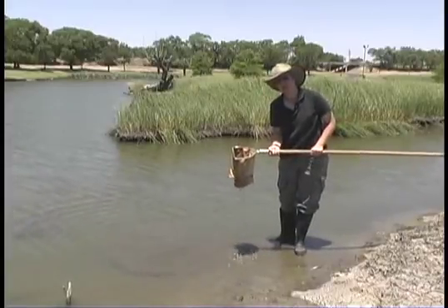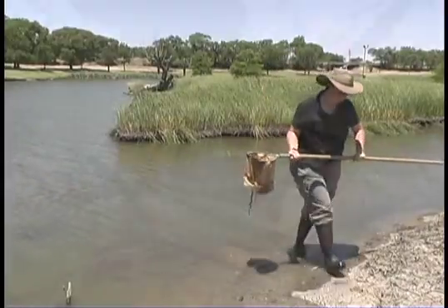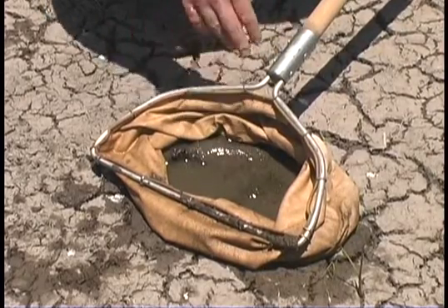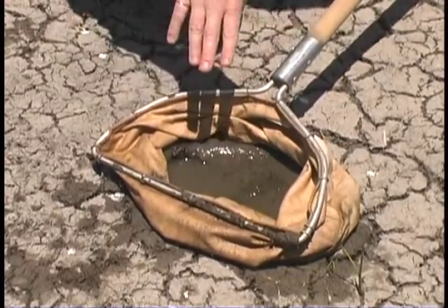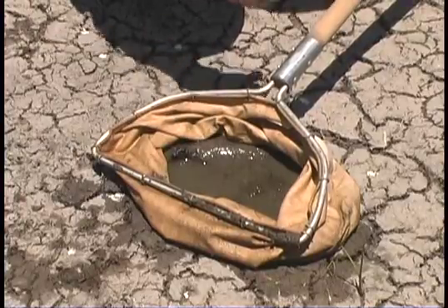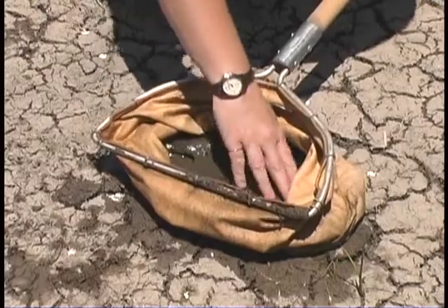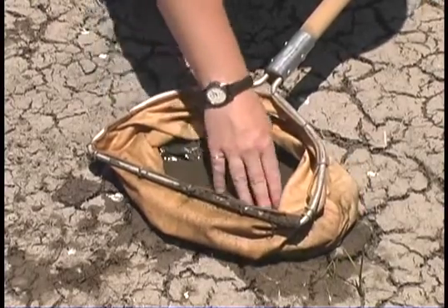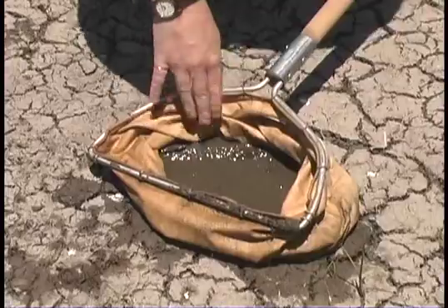Then you take this back to land and you sort it. Now you've got your d-net here with the material you've collected. You can either dump this into a container and pick out the arthropods from there, or you can do it roughly in the field — poke your way through and look for nymphs, larvae, and so forth.